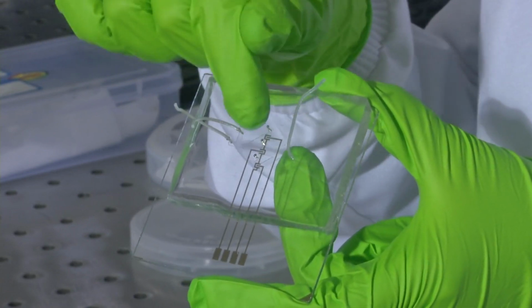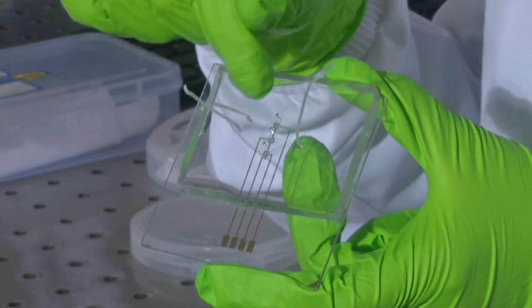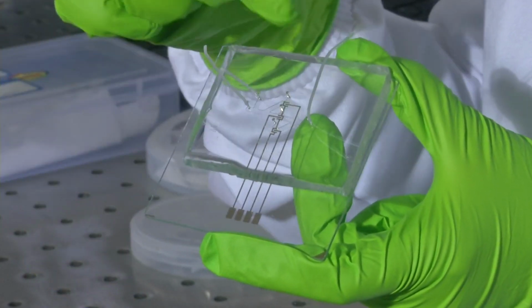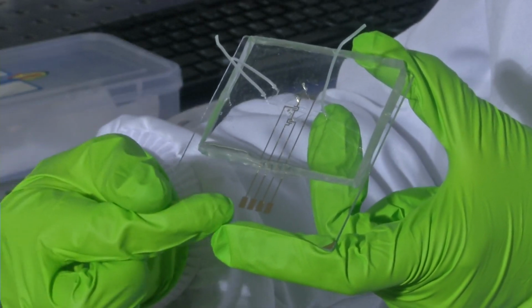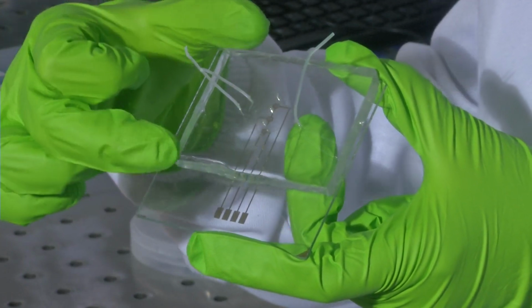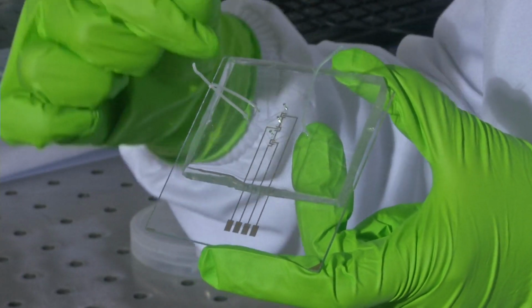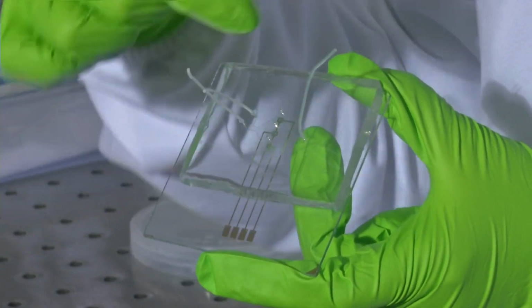So, there are these nanometer or micrometer channels which are formed on the glass plate. The glass slide already has these gold electrodes, which were etched on the glass slide. On top of that, you have this PDMS mold with features on it, and then you could see the punch through which your tubing sits.